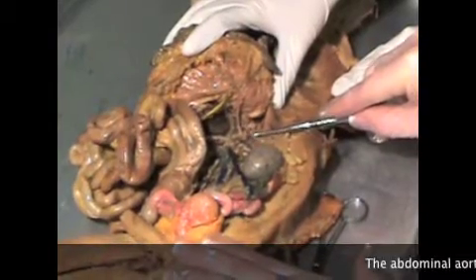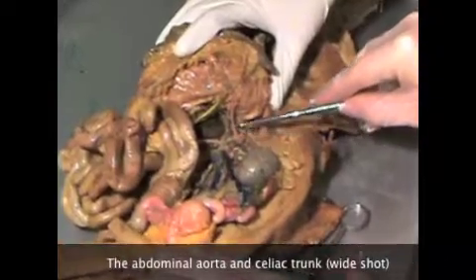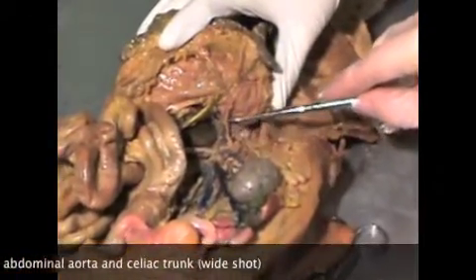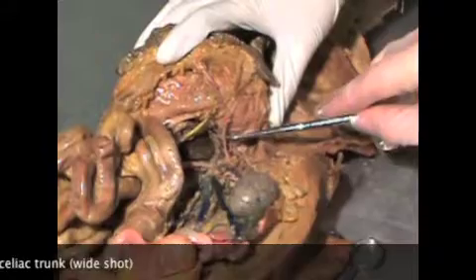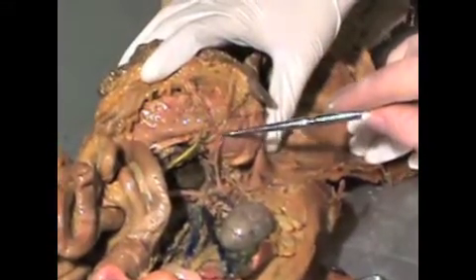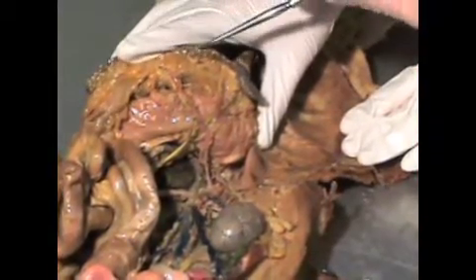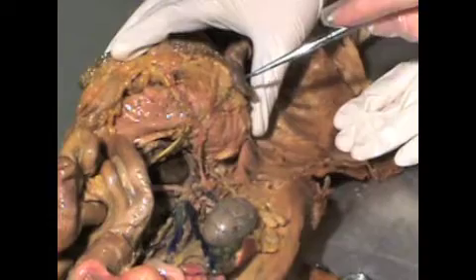Here we see the beginning of the abdominal aorta. The first branch coming off of the abdominal aorta is the celiac trunk. The celiac trunk has three branches: the splenic artery, which is Y-shaped and serves the spleen, seen here, the darker organ.